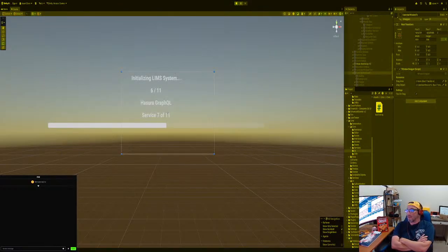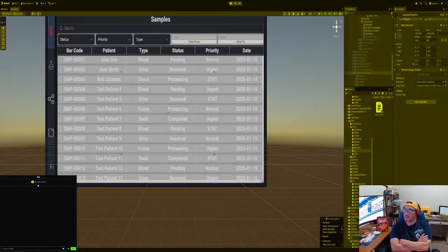So our theory is we want all of this to be nice and clean UI, but we're going to have a bunch of pop-up windows and all that stuff. We're going to add some more features to it, so that if you click on a pop-up window, it should come to the front and everything else comes to the back. We're going to do that in the next session.